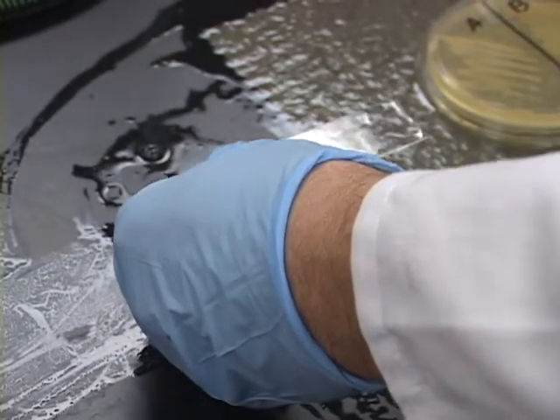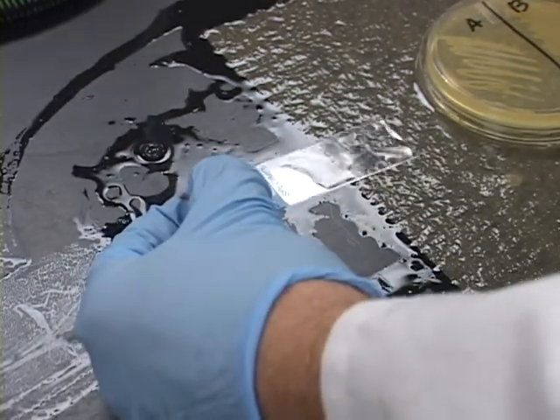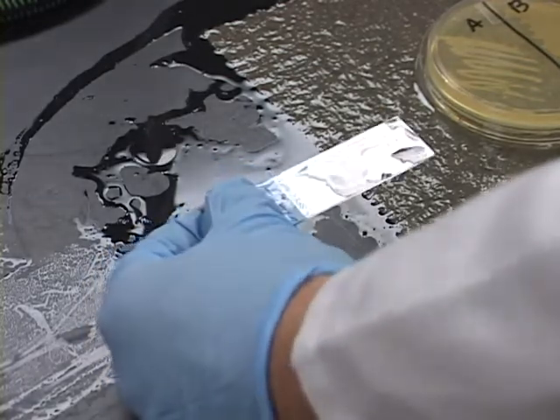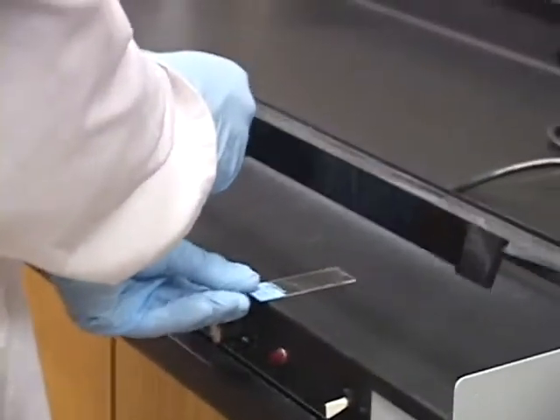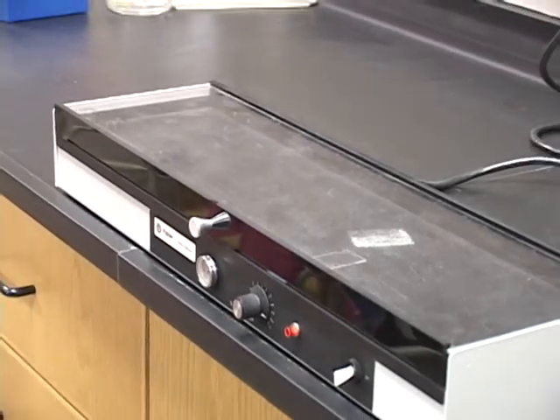After adding the microbes to the slide, we now are going to dry the slide using a slide warmer, or if we wish, we can let the glass slide sit out and dry. Transferring the slide over to our slide warmer, we will wait the designated time until the slide is fully dry.